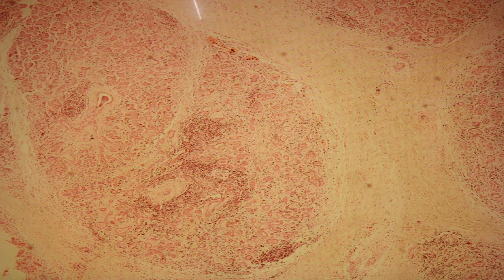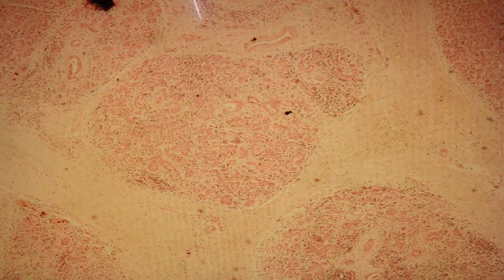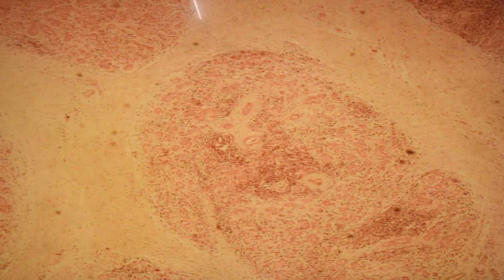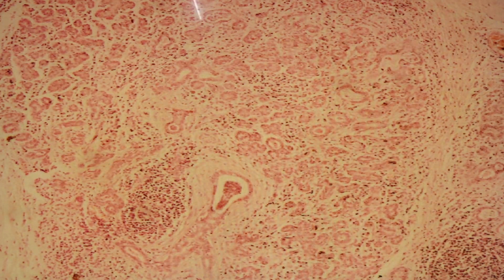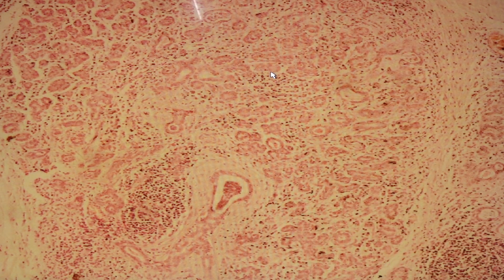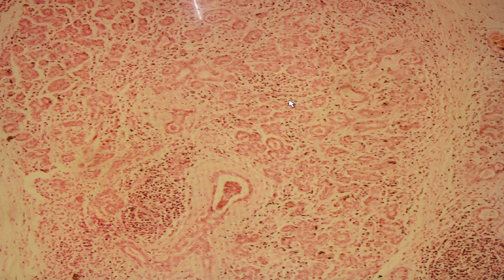Slide 263 is labeled as chronic sialadenitis, also called Sjögren's syndrome. What would be very important to look at in this slide would be the presence of chronic inflammation. Notice that we would see the presence of ducts with a lot of inflammatory cells. This is an inflammation of the salivary gland.